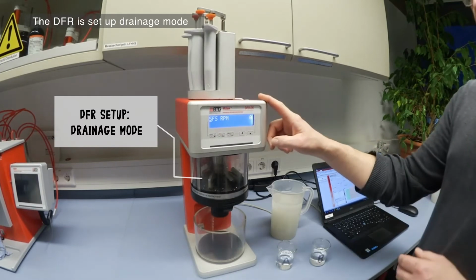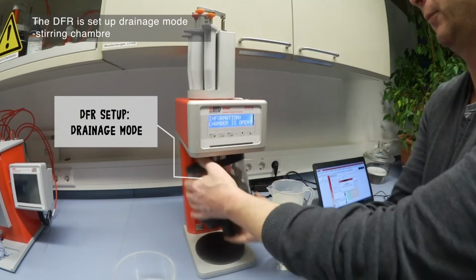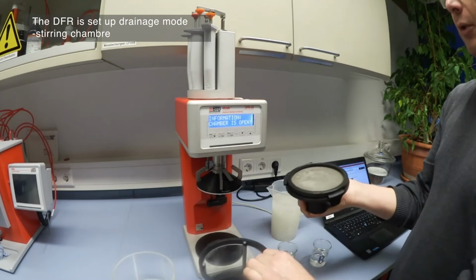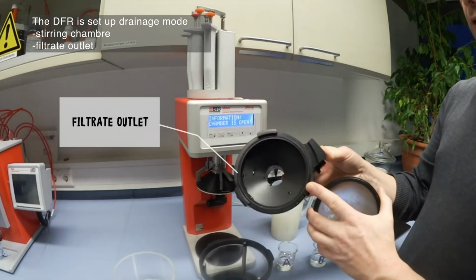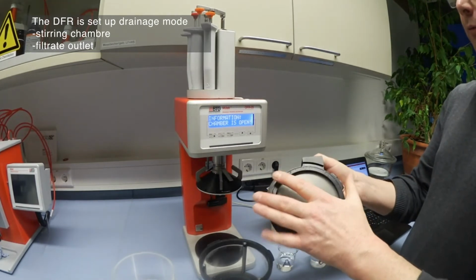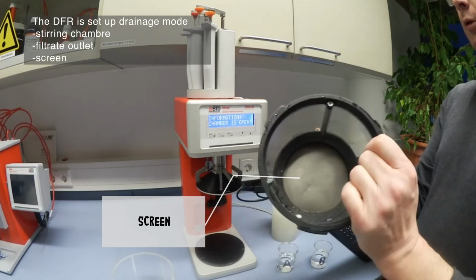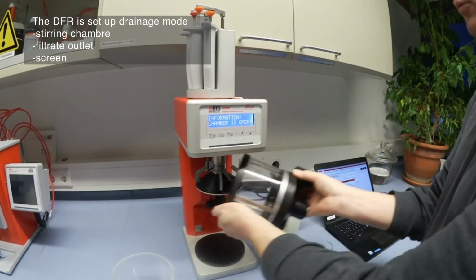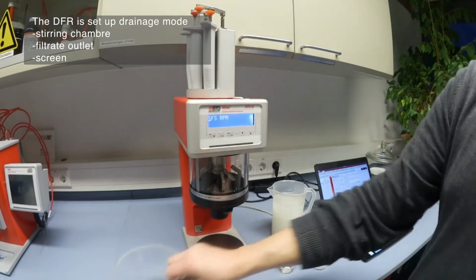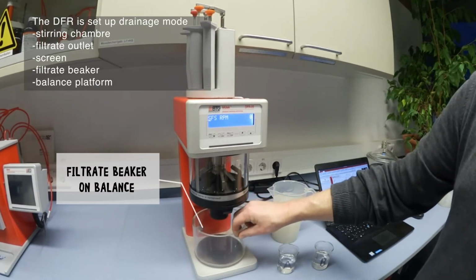The DFR is set up in drainage mode. This means that the stirring chamber is in a certain configuration. It has a filtrate outlet with a wide opening to let the filtrate drain freely. There is a screen. For this fast-draining sample, a 50 mesh screen has been selected. The stirring chamber is then assembled and attached to the device. Finally, the filtrate beaker is placed on the balance platform.